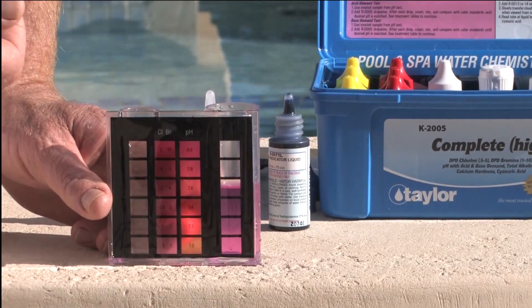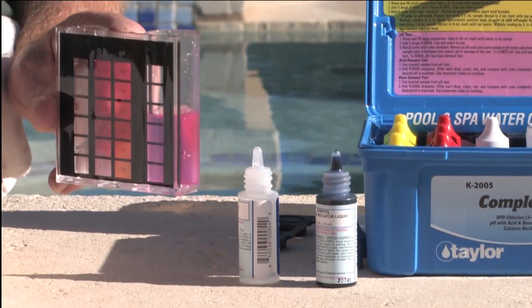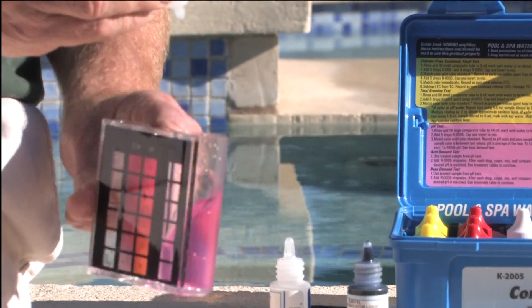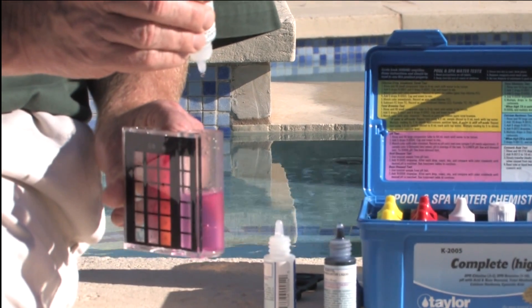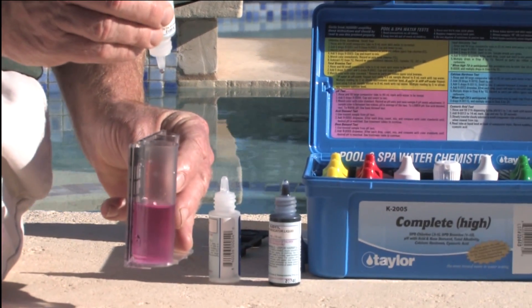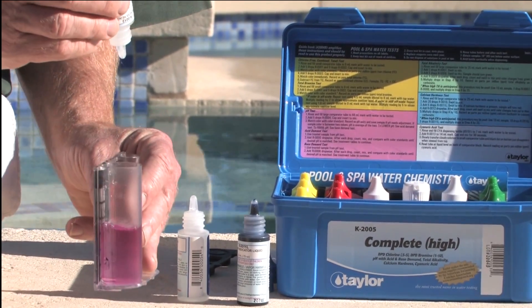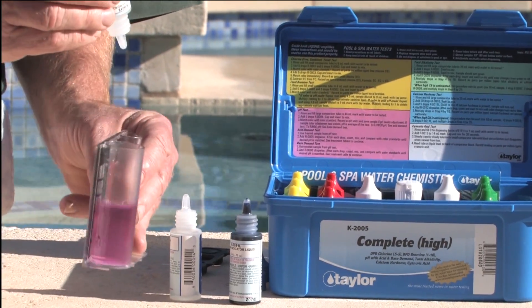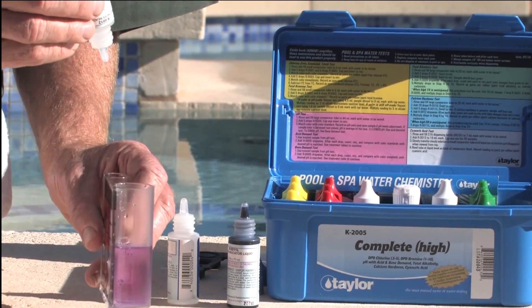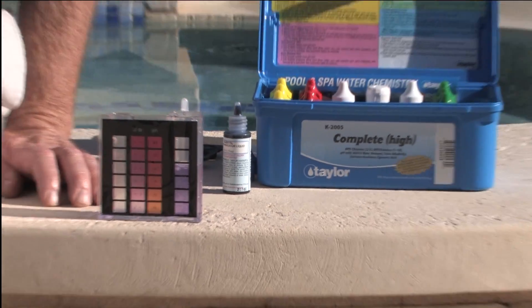Each drop is 10 parts per million, so we're looking for 20 to 30 drops. I'll put them in five at a time. 10 drops, 15 drops, and 20 drops. And we now have our wonderful blue color. 20 drops times 10 is 200 parts per million calcium hardness — a perfect amount.